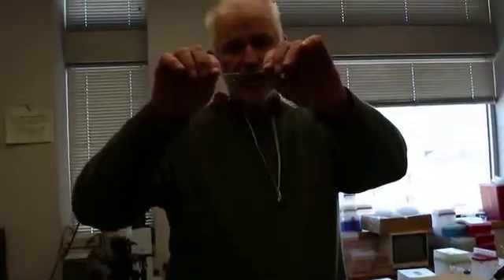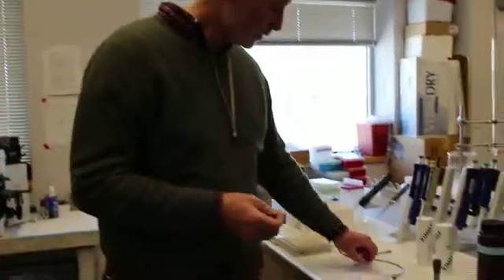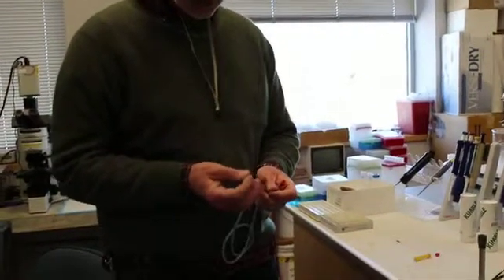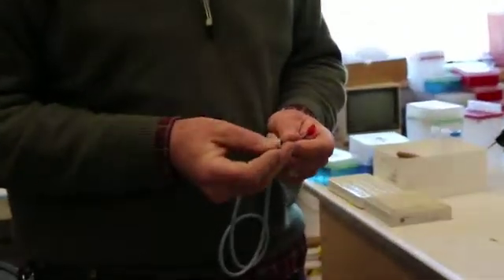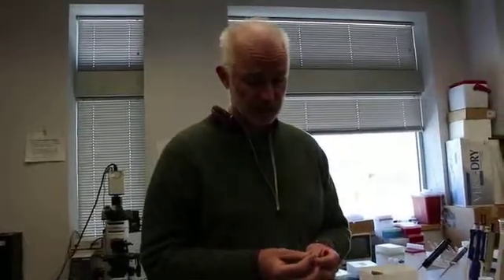Okay, so now I can bend that over and break it. And then if I break it off right about there, I have really fine capillary tubes that I can insert into my mouth pipetter and pull up individual ciliates and even push them out into a culture flask or something else.